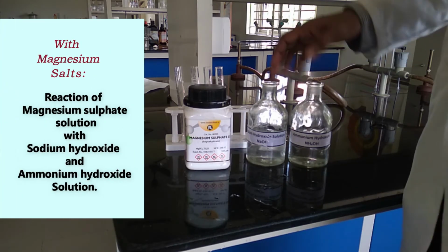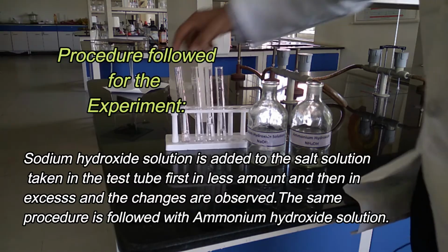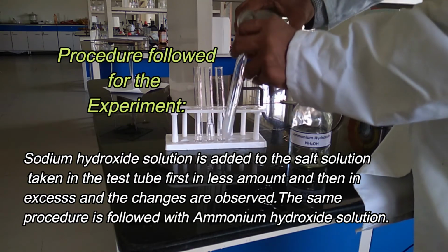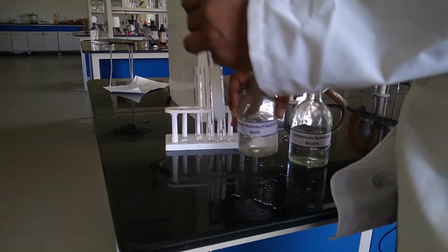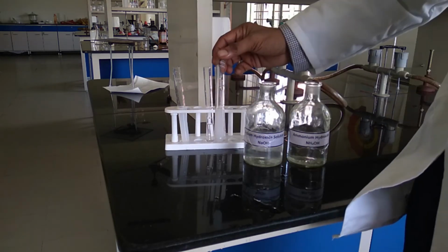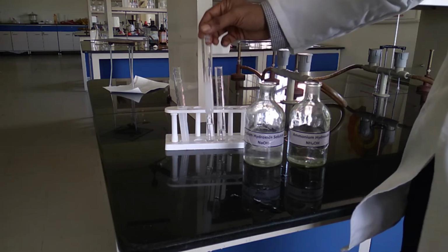See the effect of sodium hydroxide and ammonium hydroxide on magnesium salts. When we add a little bit of sodium hydroxide to the magnesium salts, it forms a white color precipitate of magnesium hydroxide. When we add too much excess of sodium hydroxide into it, there is no change. With ammonium hydroxide, it forms magnesium hydroxide, and there is no change when we add ammonium hydroxide in excess.